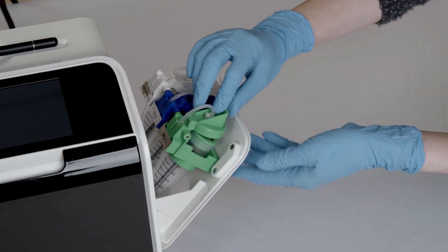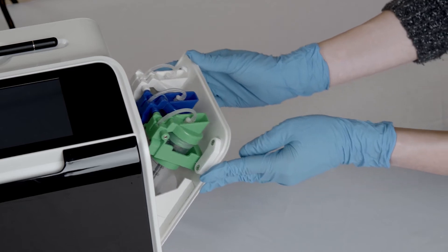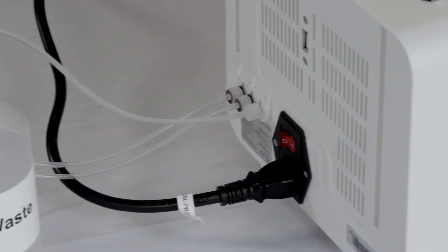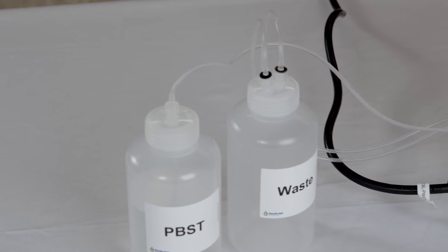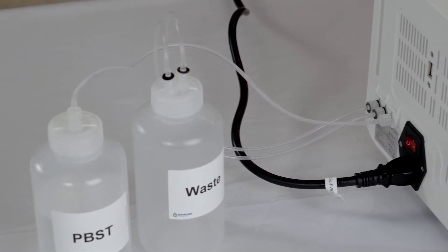Once the reagent is loaded, press the cap firmly. On the back of the device, it is attached to a bottle holding the wash buffer and a second bottle for collecting the waste reagent.